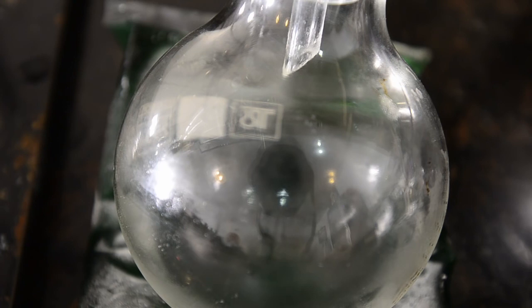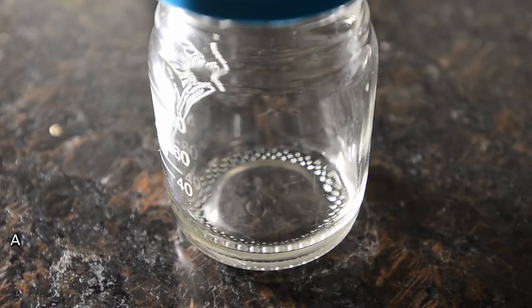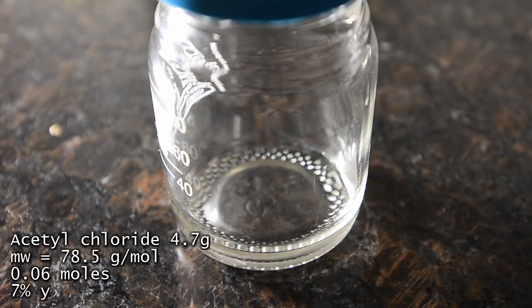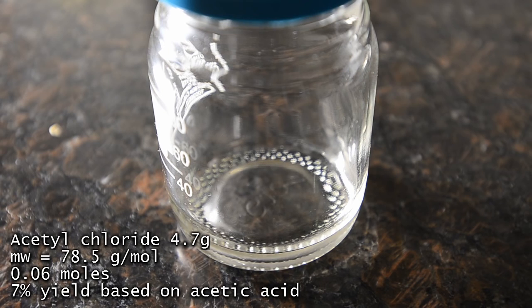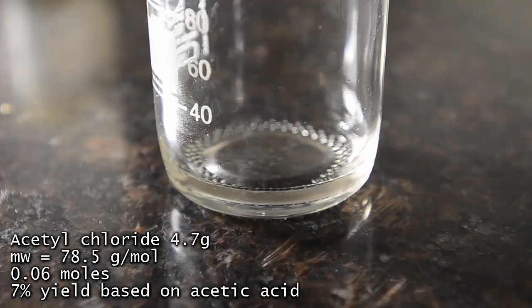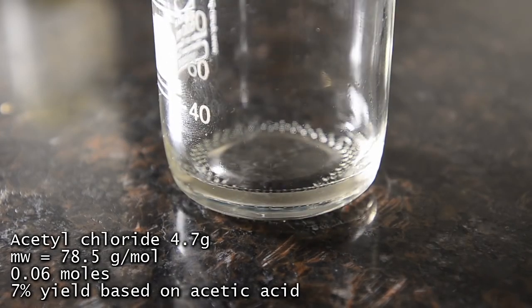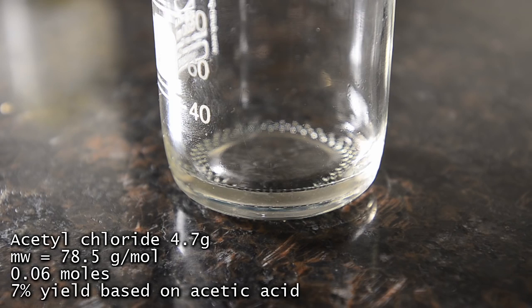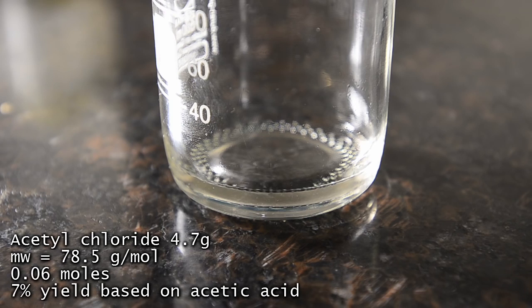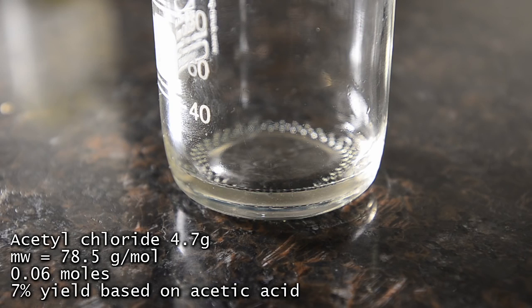Once the vapor temperature rose to 78 degrees C we stopped distilling. The result was 4.7 grams of a clear colorless liquid. This isn't a lot — if it's pure acetyl chloride it only corresponds to a 7% yield on starting acetic acid. The yield is low, but we wonder if it can be improved by using a lower temperature, more HCl gas, and fractional distillation.